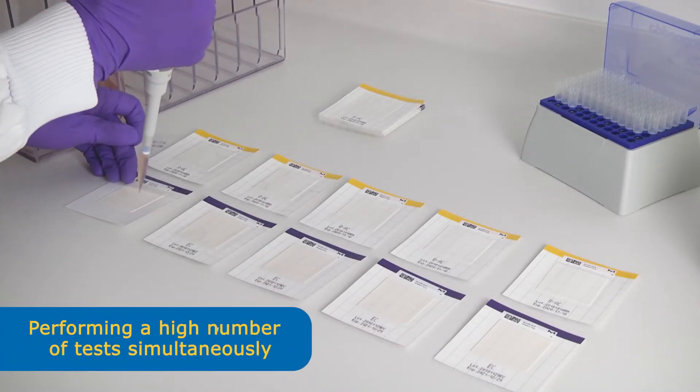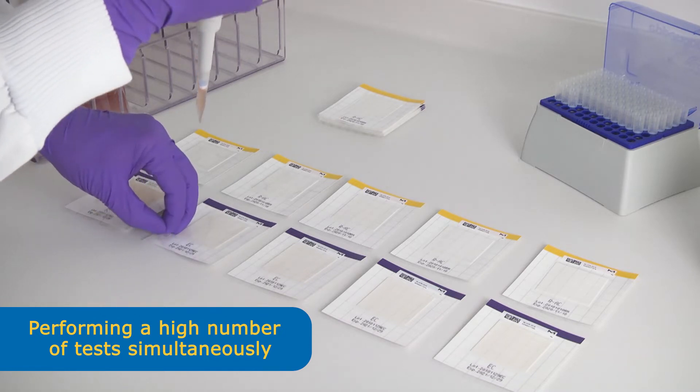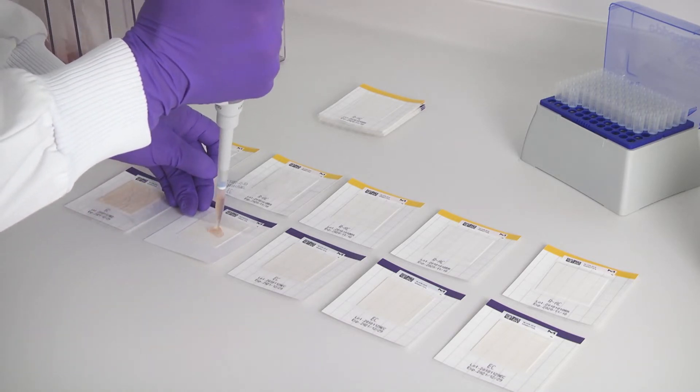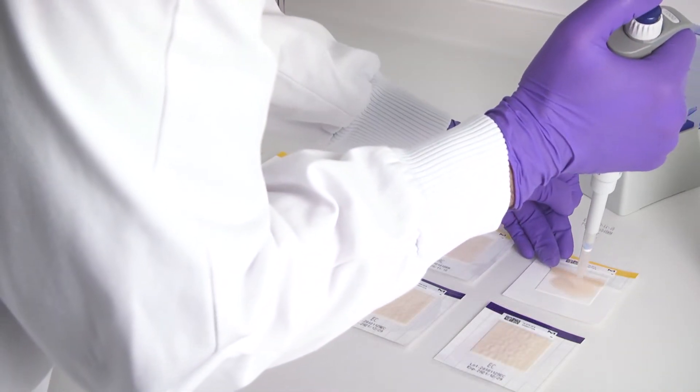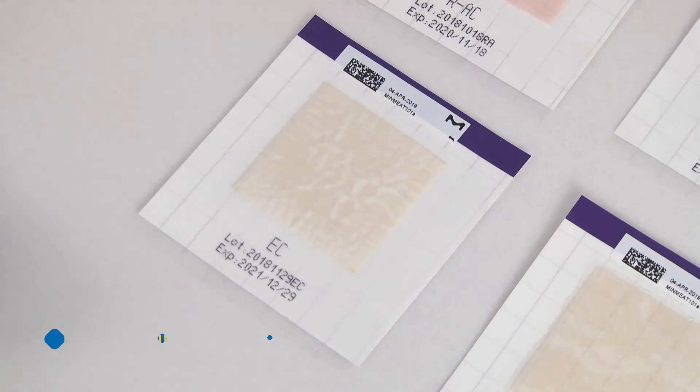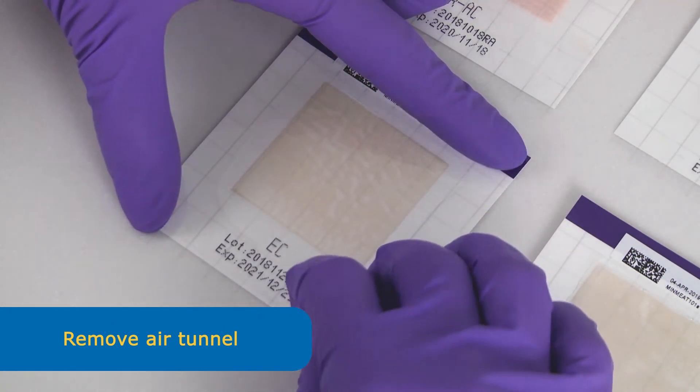To perform a high number of tests, you can open each pad and turn diagonally to apply the sample. Then move on to the next pad. Apply the samples on all the pads and then re-close all the pads properly, one after the other, removing any air pockets.